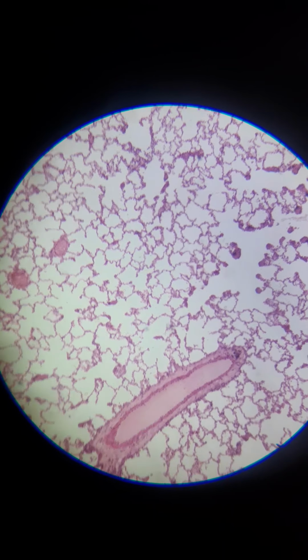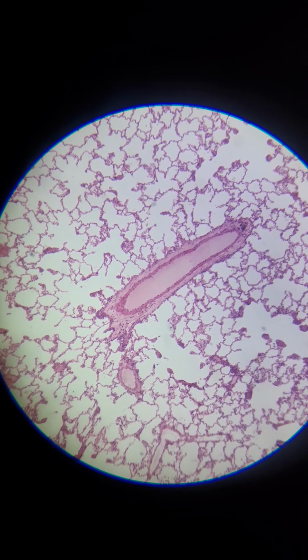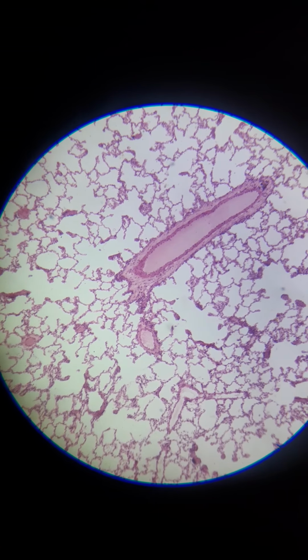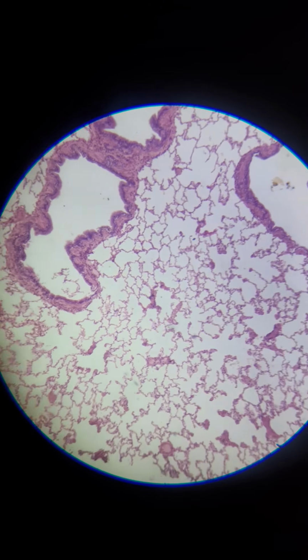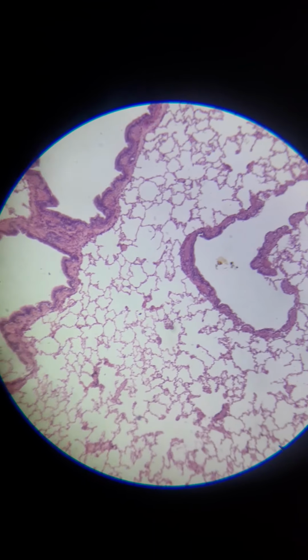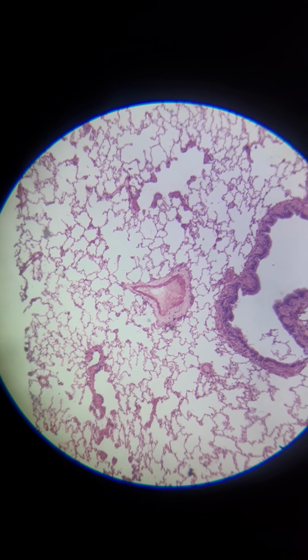All right, so you see that's a massive, that's actually going to be a blood vessel. You got two of them there. I know it looks really flat and elongated, it's kind of weird, but that's what that is. A lot of these, okay, oh, that's another vessel right there in the middle, kind of funny shaped.